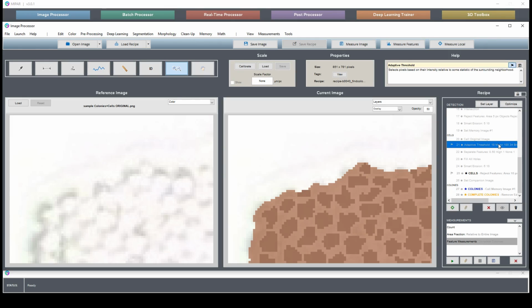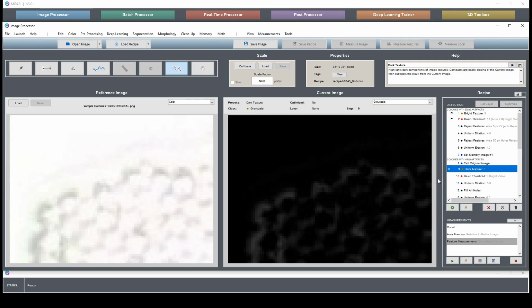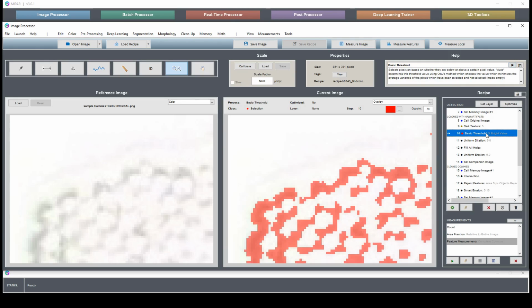And why is that? Well, if you remember back, we had two different methods of finding the proper boundaries of these colonies. First was a bright texture, which of course finds bright concave features. We were okay with that because these were going to get removed with our dark texture. You see, the dark texture doesn't find this. So where did this come from? And why did they end up in our final cells segmentation? Well, it comes from the manipulations we did after our thresholding.